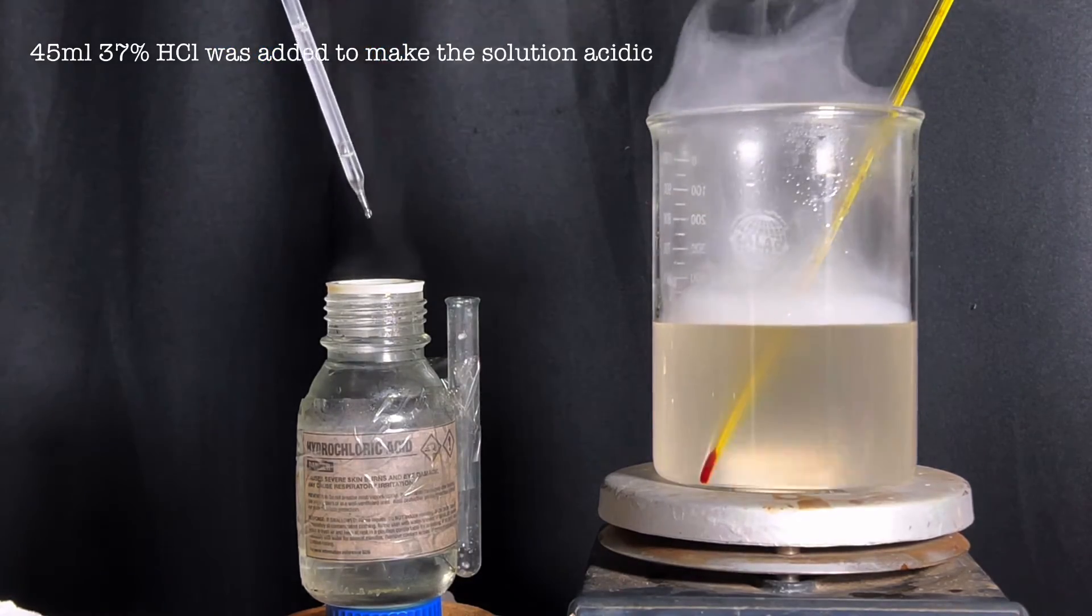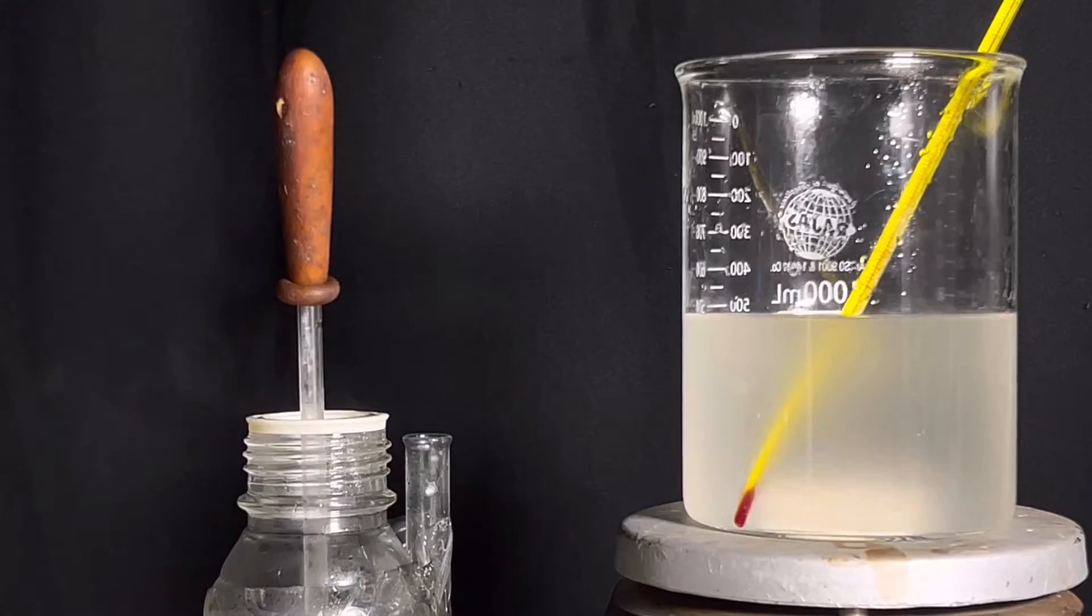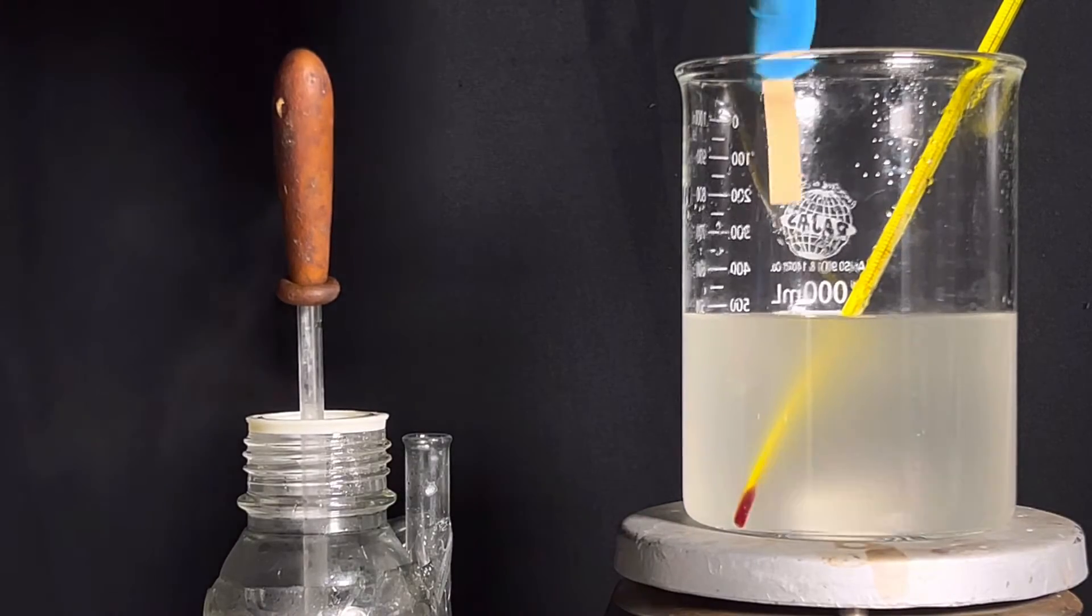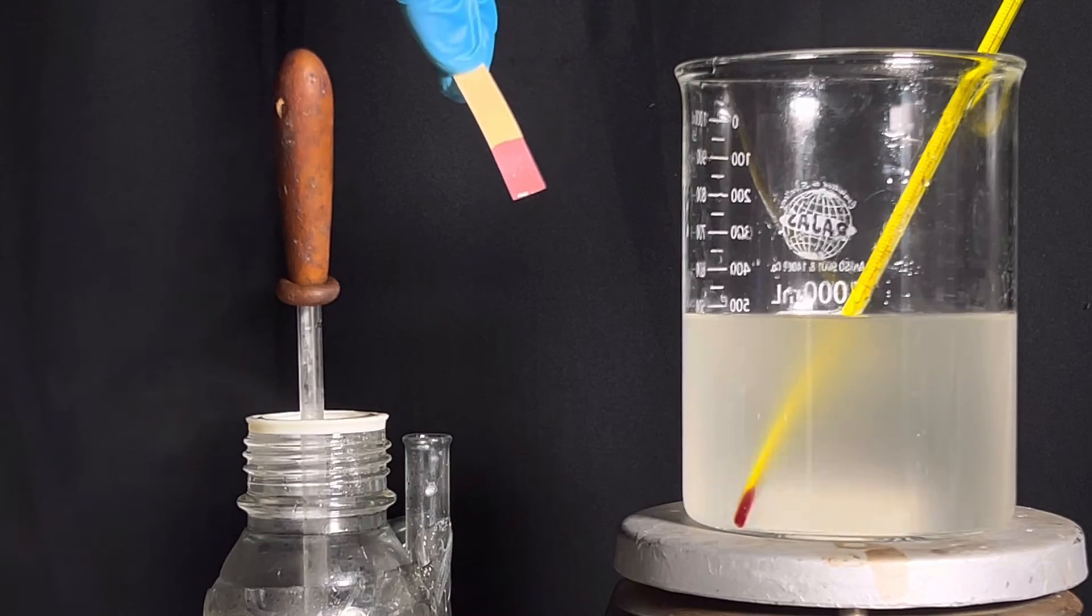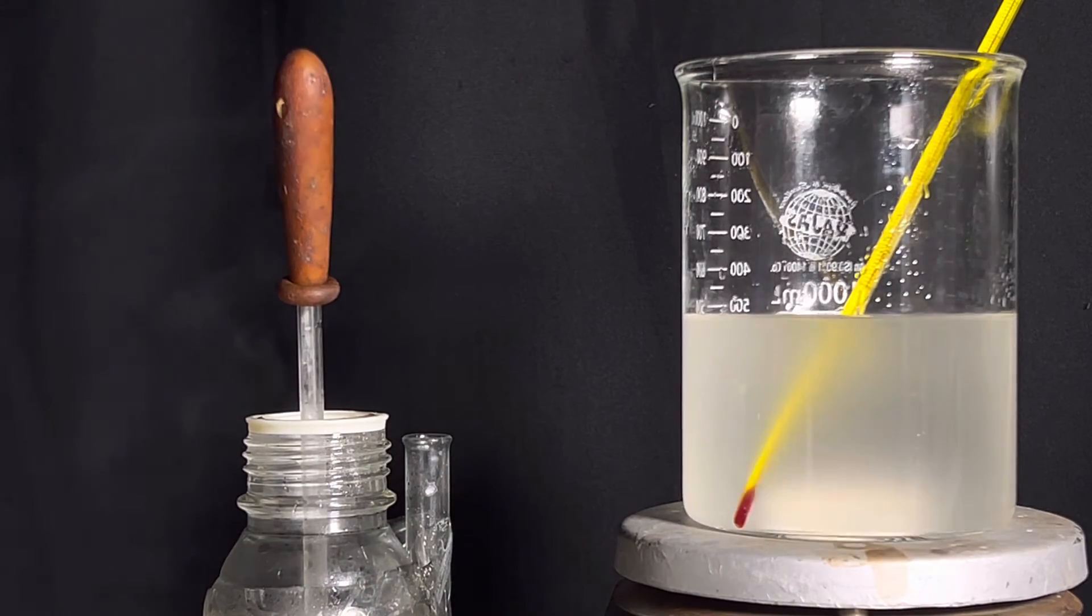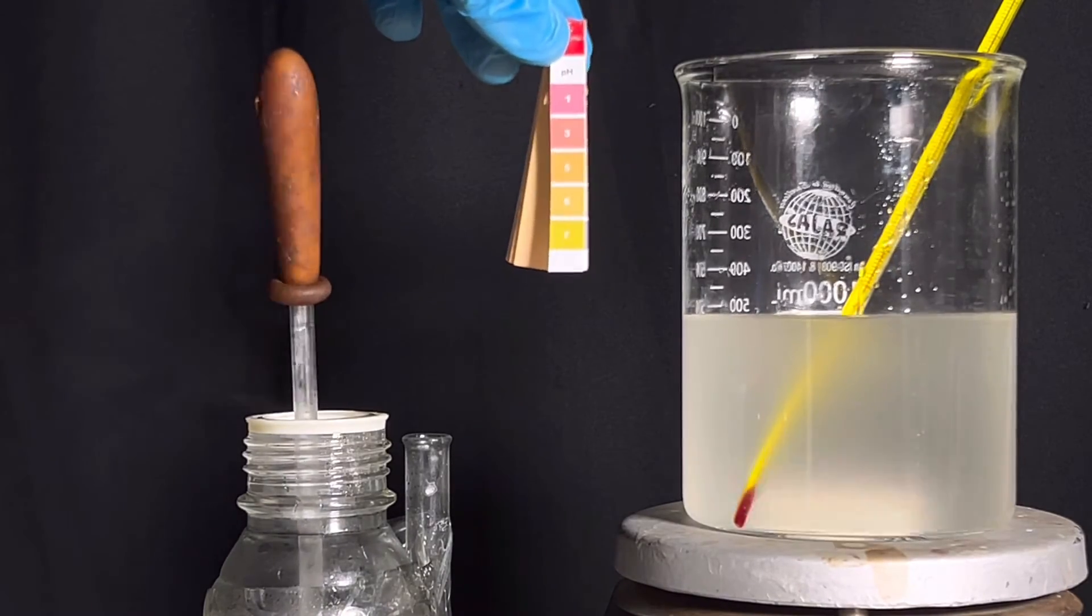As per the literature, I kept it in the fridge overnight for recrystallization. But here's the twist: nothing happened the next day. There were no crystals. So I kept it aside and redid the experiment, this time using minimal amount of water, but still it didn't work.